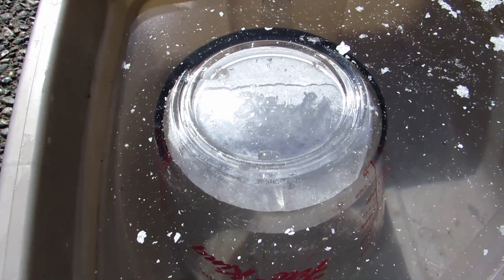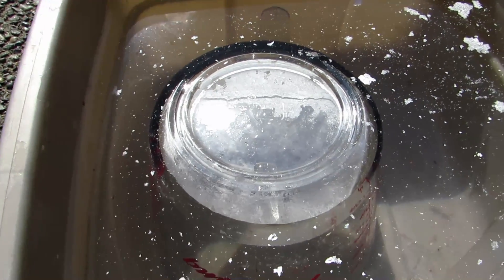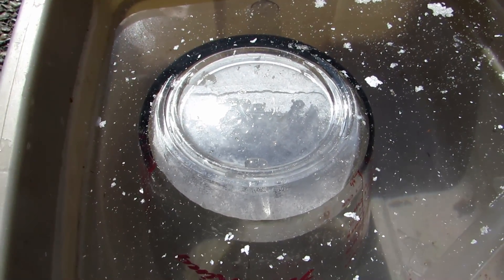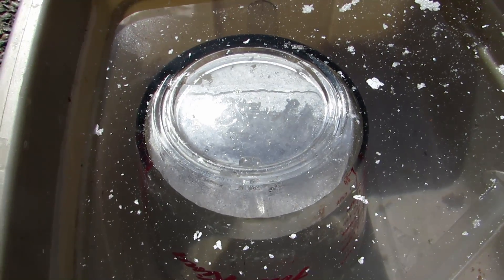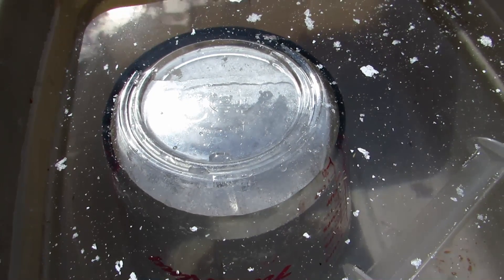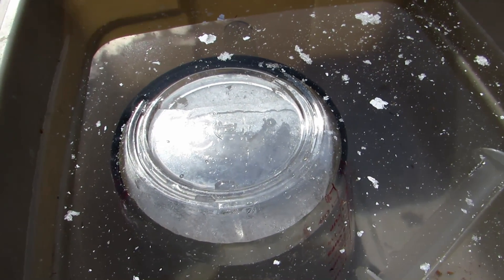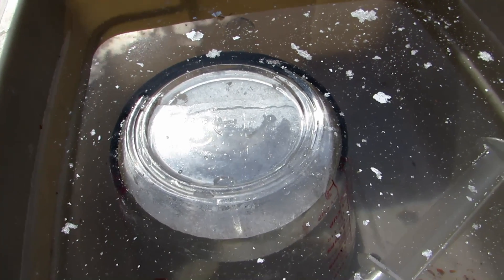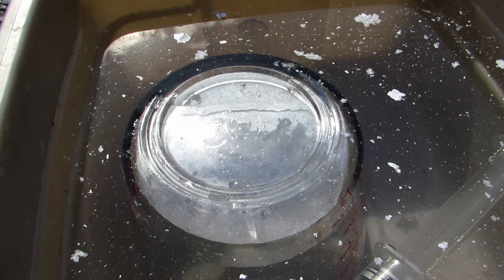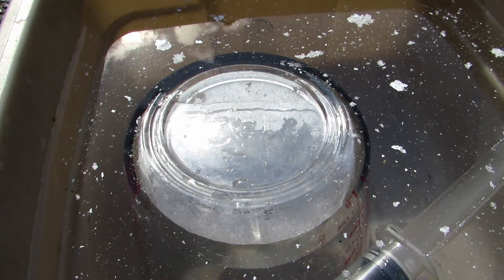Once we've broken it, all that white powder stuff on the inside comes off. This is totally harmless. Some of the mercury vapor light bulbs — the compact fluorescent light bulbs, normally you'll see them as the swirly ones — actually do contain mercury and are rather toxic, so you want to avoid those. But just normal incandescent light bulbs, the ones with the filament that gets really hot, any of the white ones are just coated with something, probably just for look.